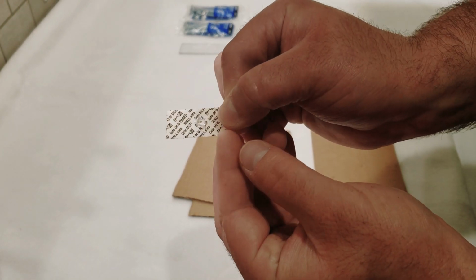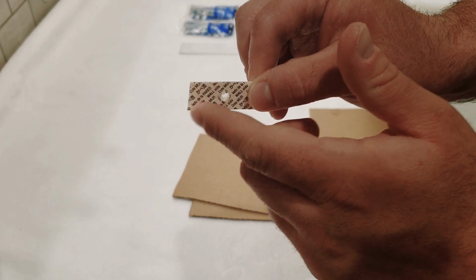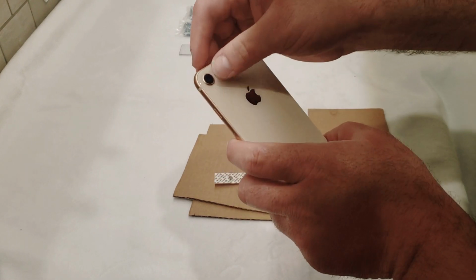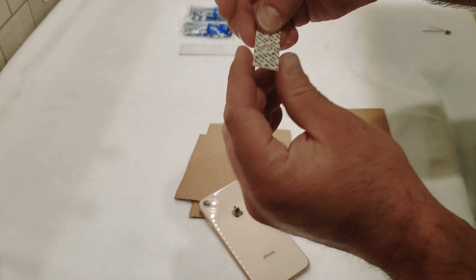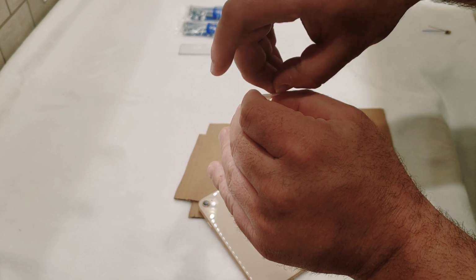But now you can see we've got our little lens. This part will be going to our phone. And so let's go and get that. And well, all we're going to do is take this now and let's peel the backing off of this so we get the sticky side out.